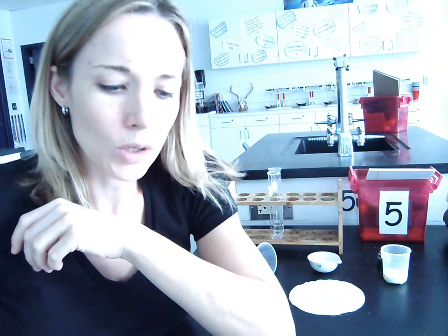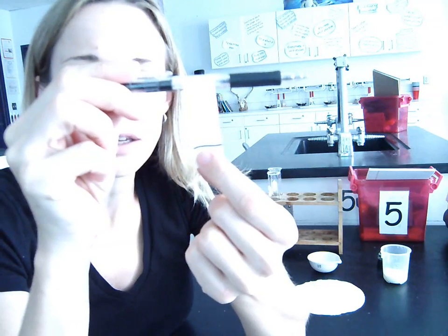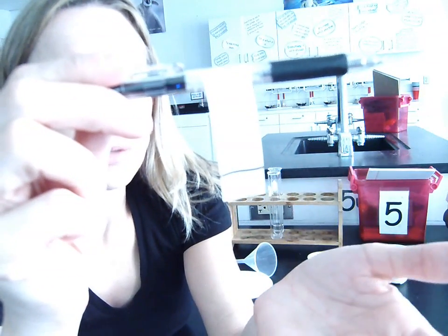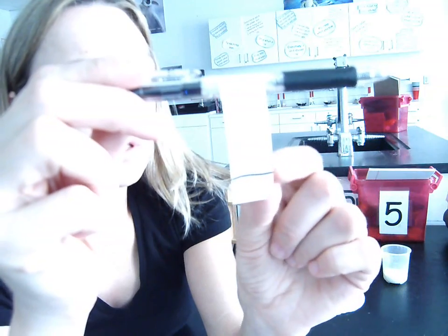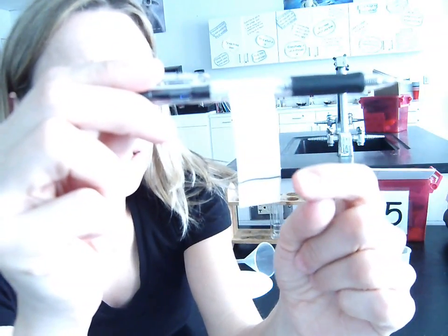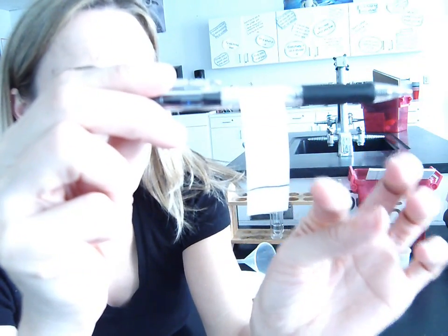5.6 is called paper chromatography. Basically, the purpose of this lab is to take a very small quantity of ink. You can see on the piece of paper, I just drew one line of black ink. In terms of the volume of ink that we're using in this experiment, it's very, very tiny. If you were to think about being able to squeeze that amount of ink and measure its volume, it's probably a number that we can't even measure based on the equipment that we have. So that's a very, very, very small quantity of ink.